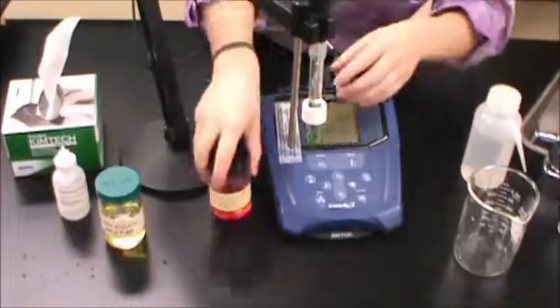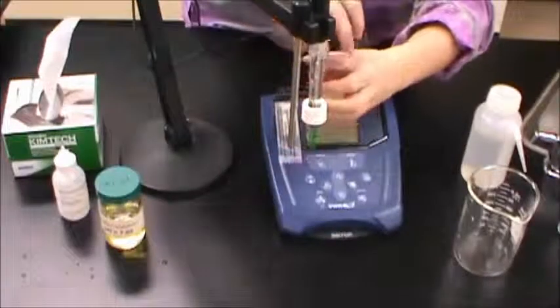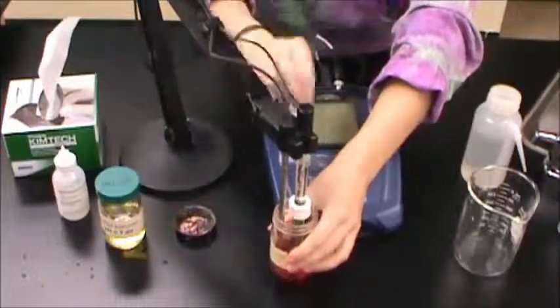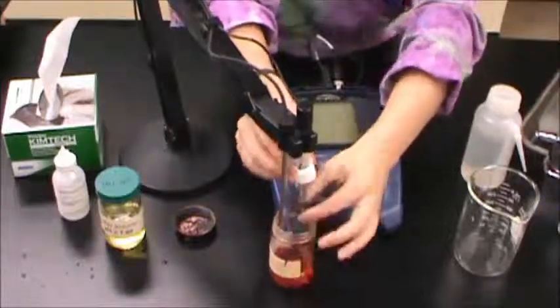Place the probes in your chosen buffer solution. Either pH will work, there should be four or seven available. Swirl the container gently to get rid of any bubbles around the ends of the probes.